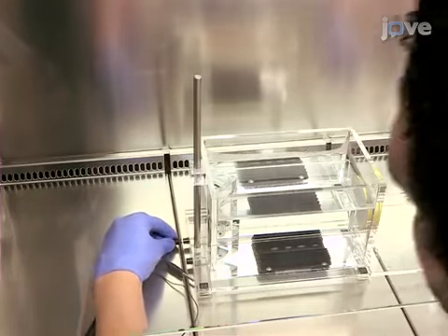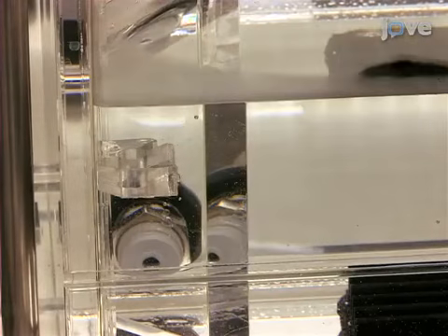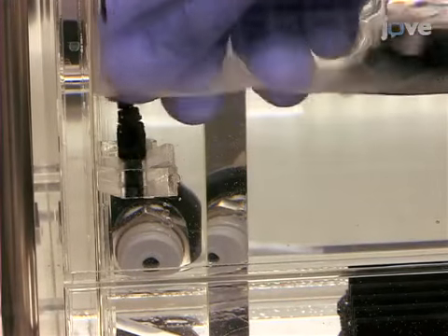Next, connect the temperature sensor to a power supply and place the temperature sensor in the fitting on the back wall of the water bath.